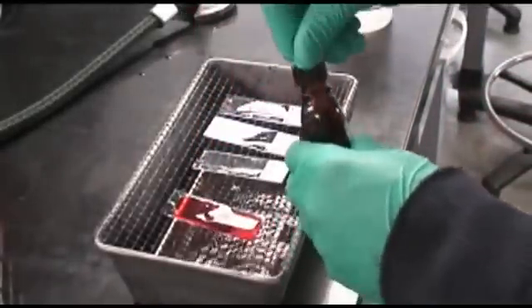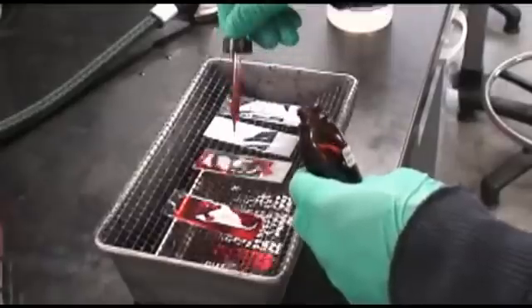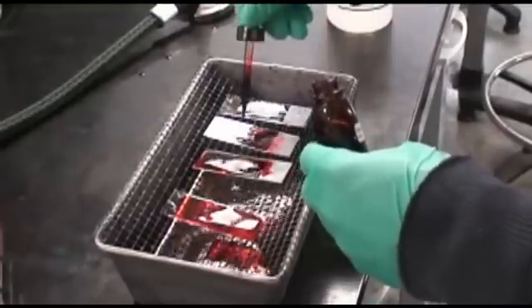Again, rinse the slides and then cover them with the counterstain safranine for 60 seconds.